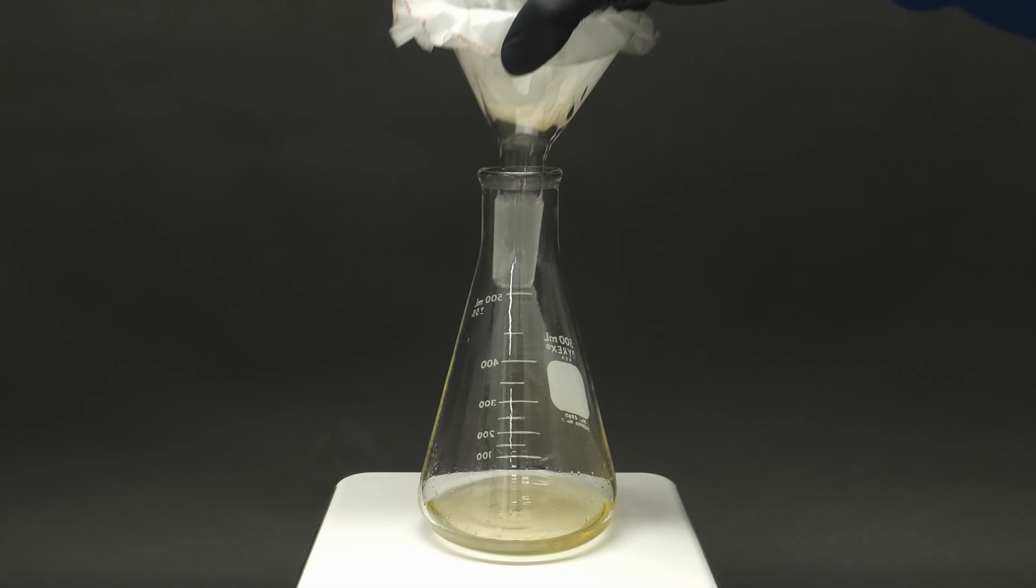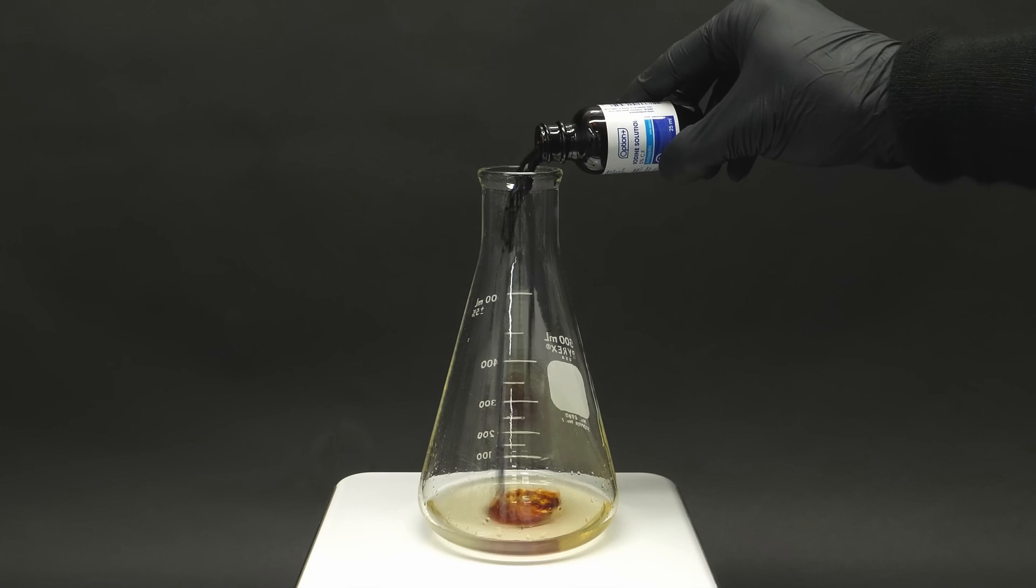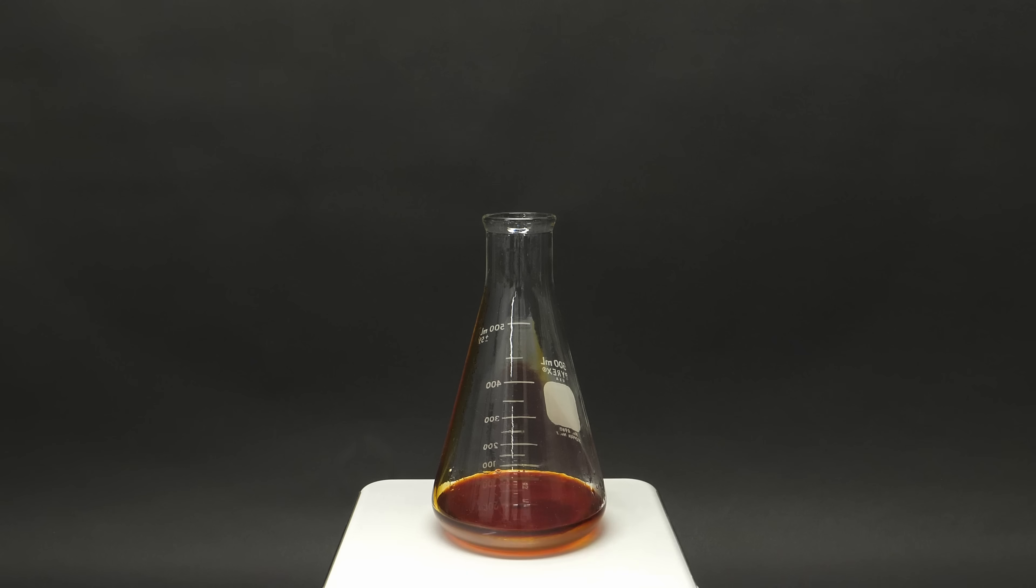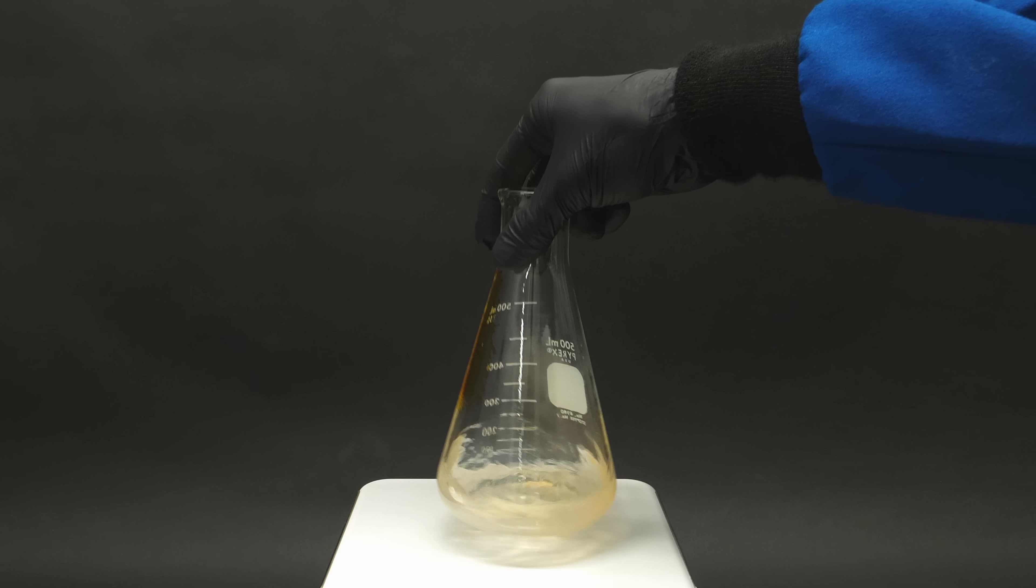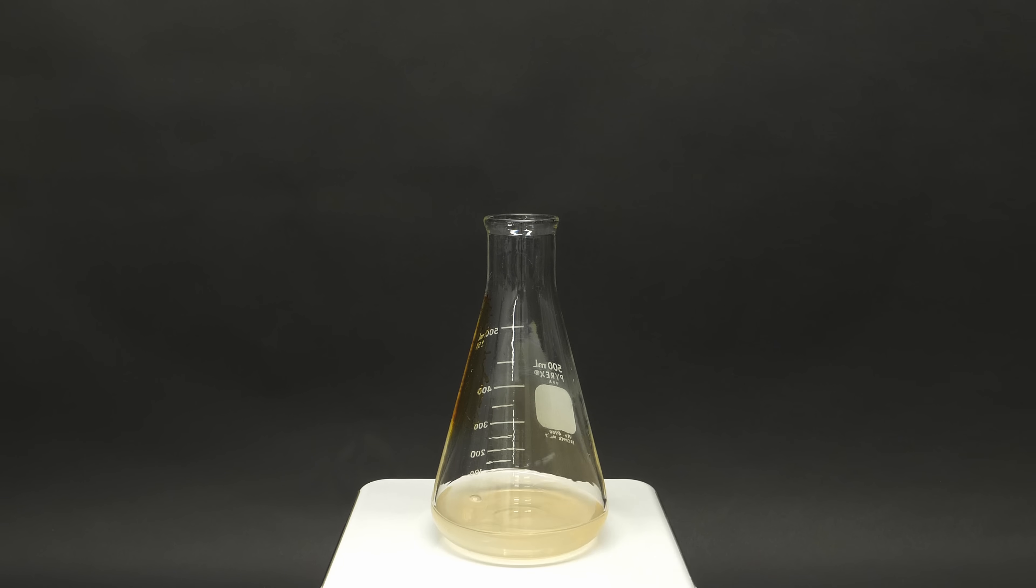Now that it's done, I'll add an entire bottle of iodine disinfectant. The color immediately disappears, and this is because the vitamin C is reacting with the iodine.